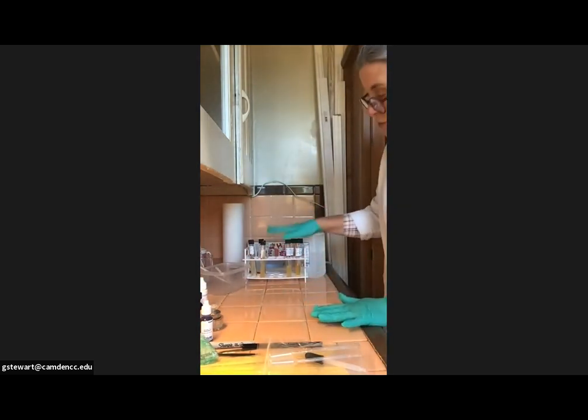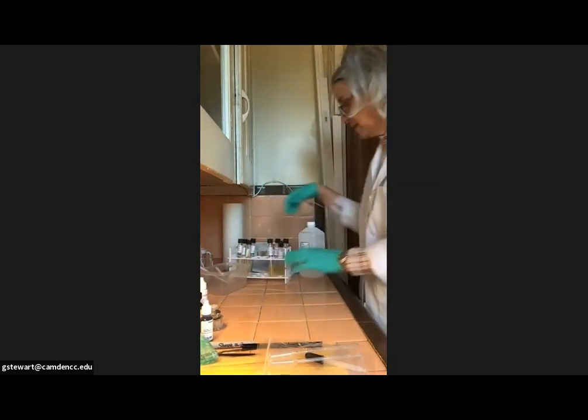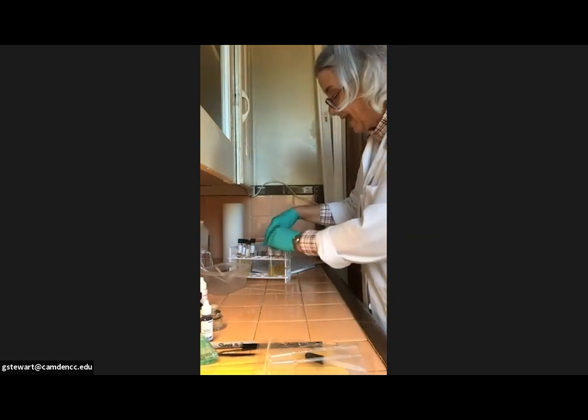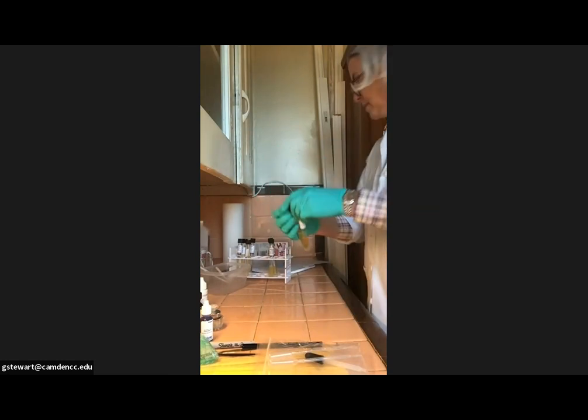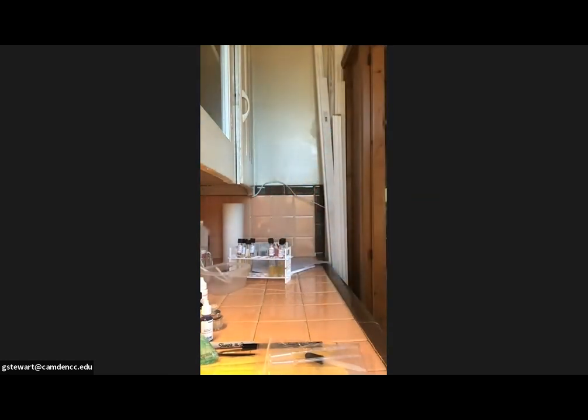So aside. I have my cultures here in my little test tube rack. They're labeled. Remember, we rehydrated 2 of them a couple of days ago, and then we rehydrated the E. coli and the staph epi yesterday. And they look well grown up. In order for us to be able to take a look at them, I'm trying to find a piece of construction paper. Anything that's a dark background, they will show up a lot better for you to see. If I can find something that's black to put them up against.